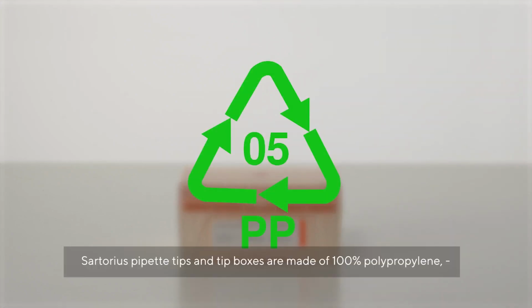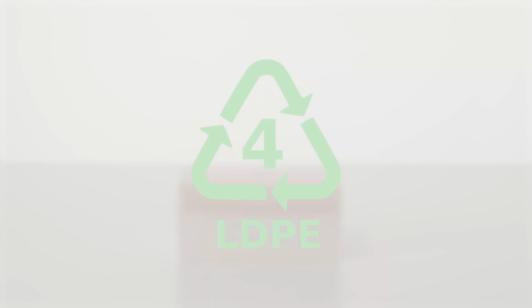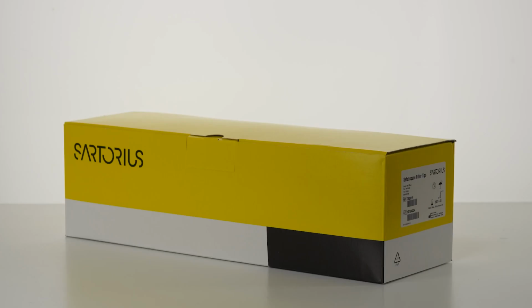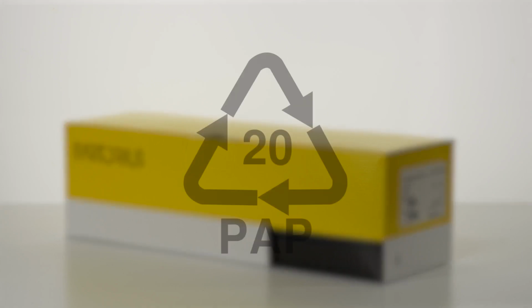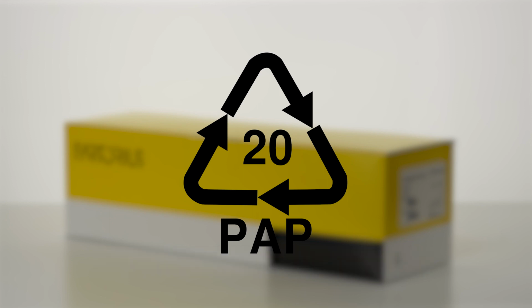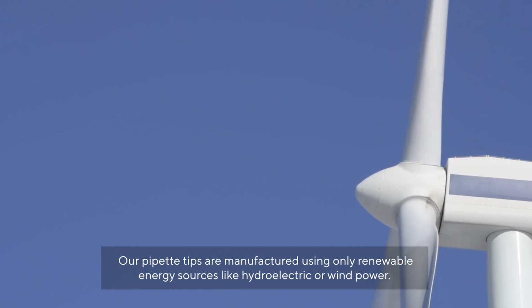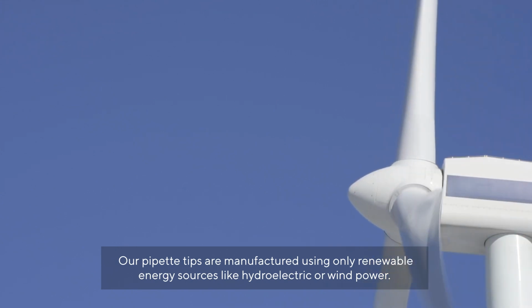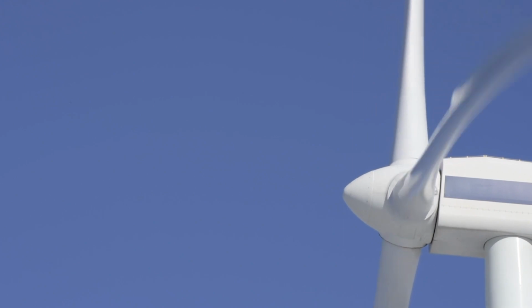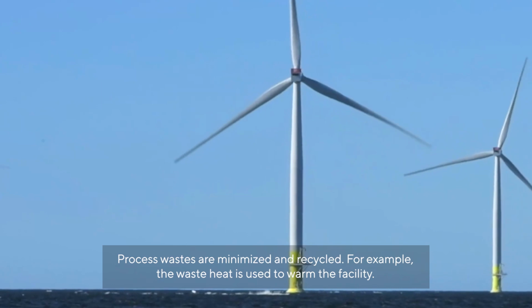Sartorius Pipette Tips and Tip Boxes are made out of 100% polypropylene and the filter and wrappings are 100% pure polyethylene and are fully recyclable. The outer package is recycled and recyclable cardboard. Our pipette tips are manufactured using only renewable energy sources like hydroelectric or wind power. Processed wastes are minimized and recycled. For example, the waste heat is used to warm the facility.